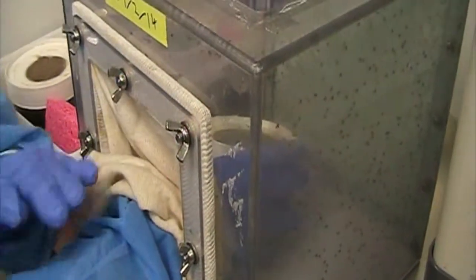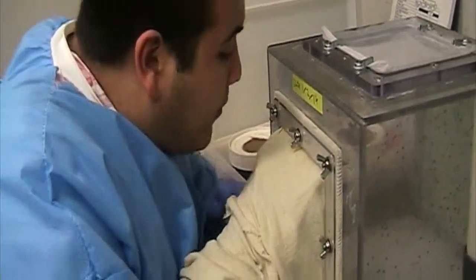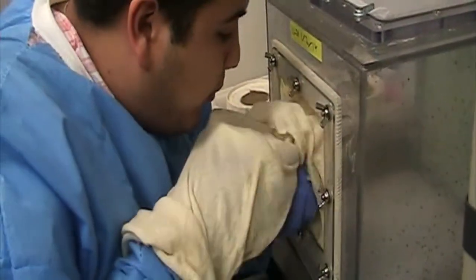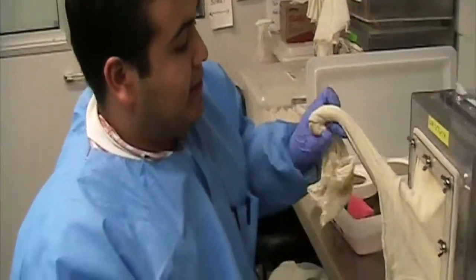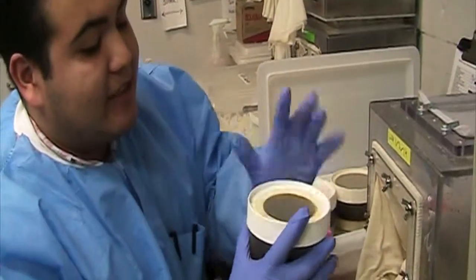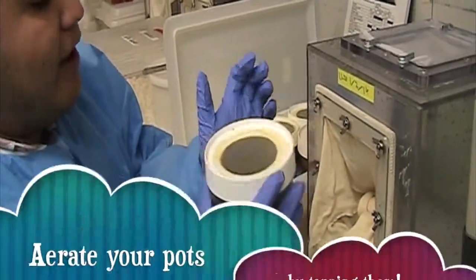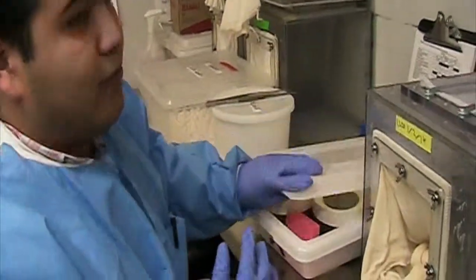After we do that, we go back inside, then grab the lid and put it back on top of the cage and tighten it. It's not going to be tightened all the way — you'll have to finish tightening once you get outside the cage. You blow air inside so your flies won't stick to the lid and won't try to escape. Then you finalize and tighten the lid, shake it, and tap the pot just a little bit to move what's inside all around. Then put it back and release the other one.